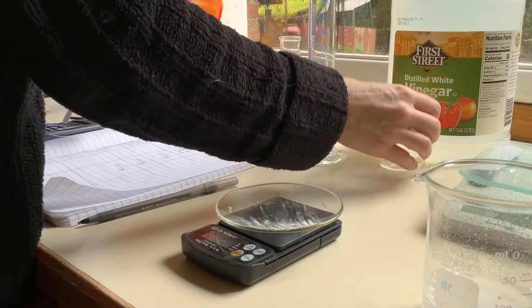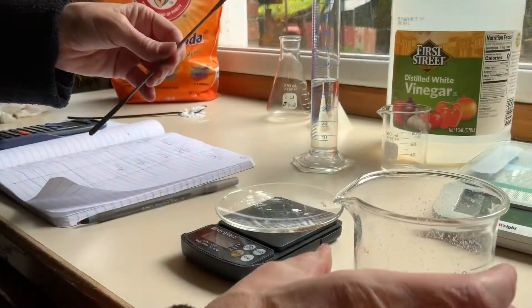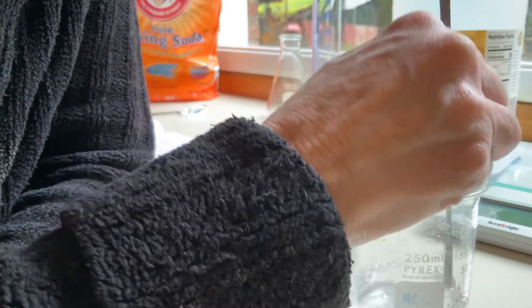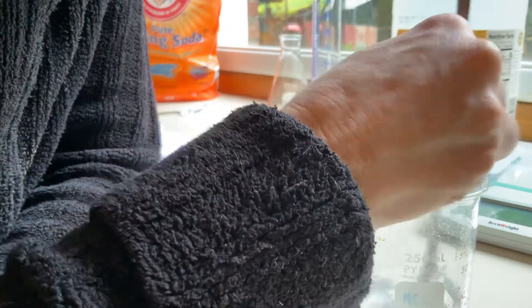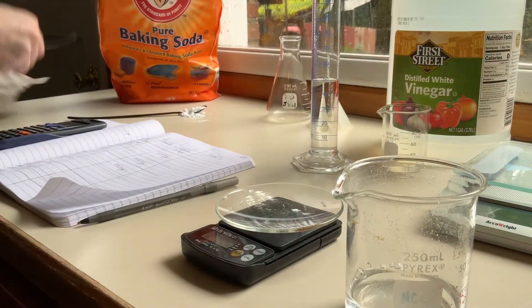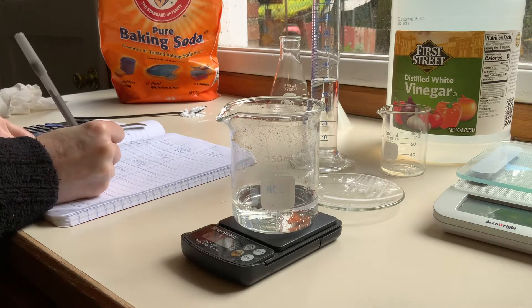I'll line up my next trial. 50 milliliters — it doesn't have to be perfect. Let's give this a swirl. I see a little bunch of stuff in the bottom so I'll stir that a little bit. Normally we'd like to use a glass stirring rod, but I don't have one so I'm using a spatula. I'll weigh the beaker after the reaction — the beaker with the products after reaction is 161.2 grams.